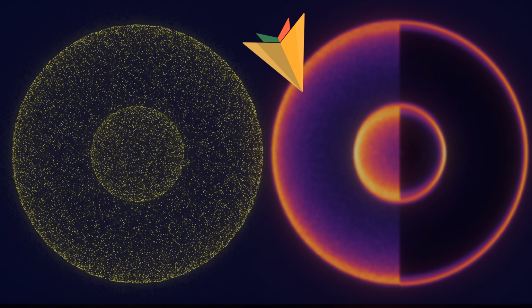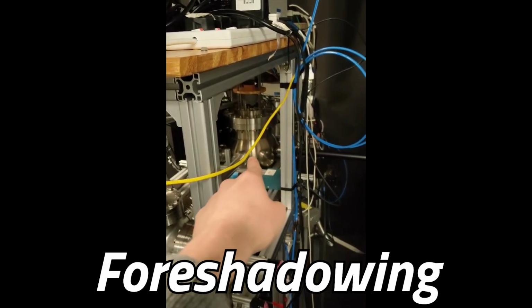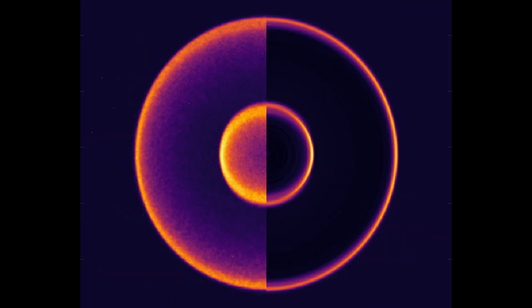I just want you to reflect on that fact for a second, okay? This image on the right, this heat map, is actual, real electrons hitting the real detector. Here's a picture, and the video. Isn't that awesome? But the point I'm trying to make here is that when you take a look at these pictures, this is how we actually get them.